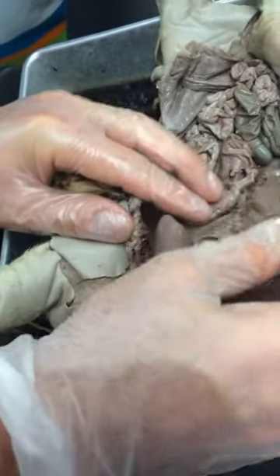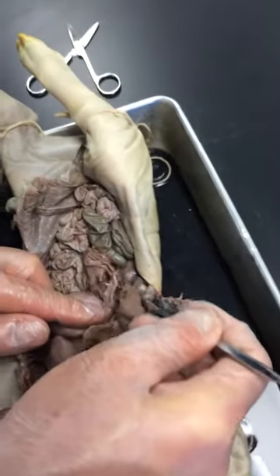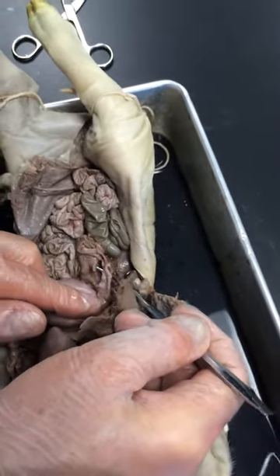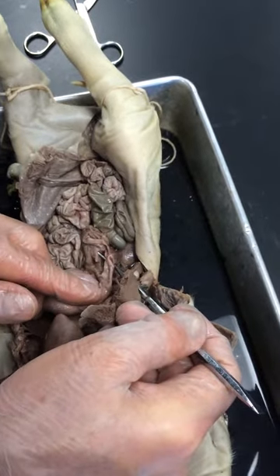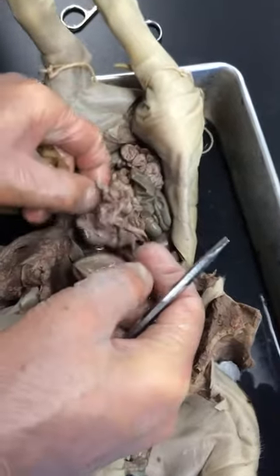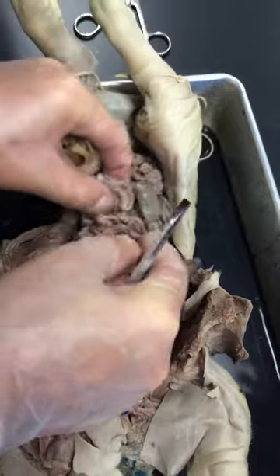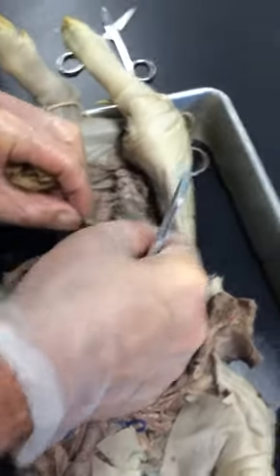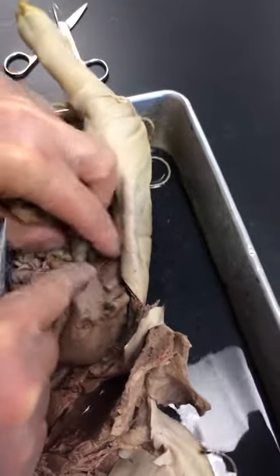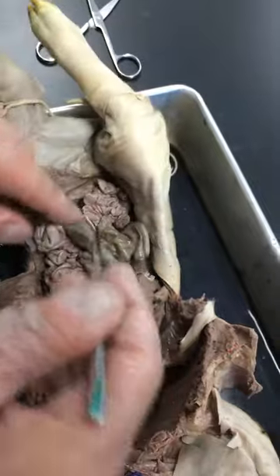Small intestine — there are three parts you should be able to distinguish. The first part coming off the stomach is the duodenum, right there. Jejunum is this middle portion right here. So up here would be the jejunum, and then when you get down to where it joins the large intestine — the first part of which is the cecum — it's known as the ileum. Here's the cecum, this big sac-like structure right here.